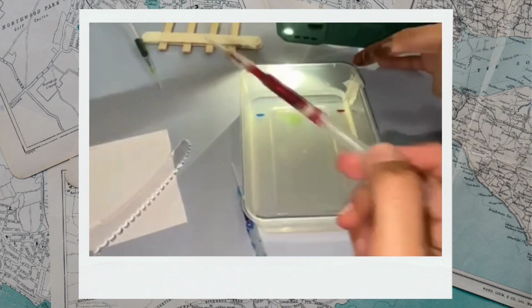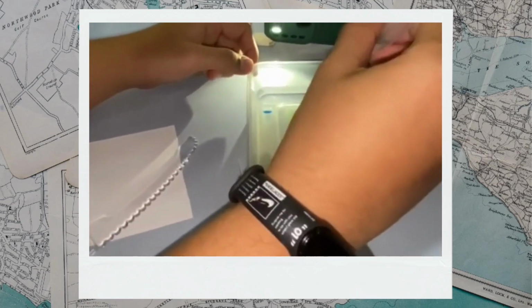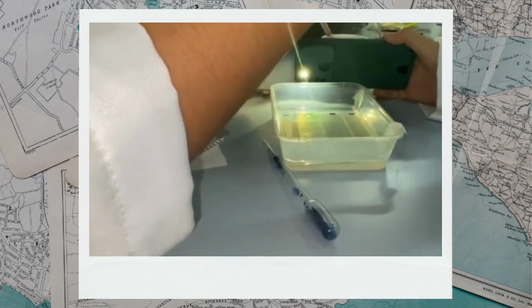Be sure to use a new pipette for each sample to prevent contamination between samples. If you have a limited supply of pipettes, thoroughly rinse out the tip in a large beaker of water before using.